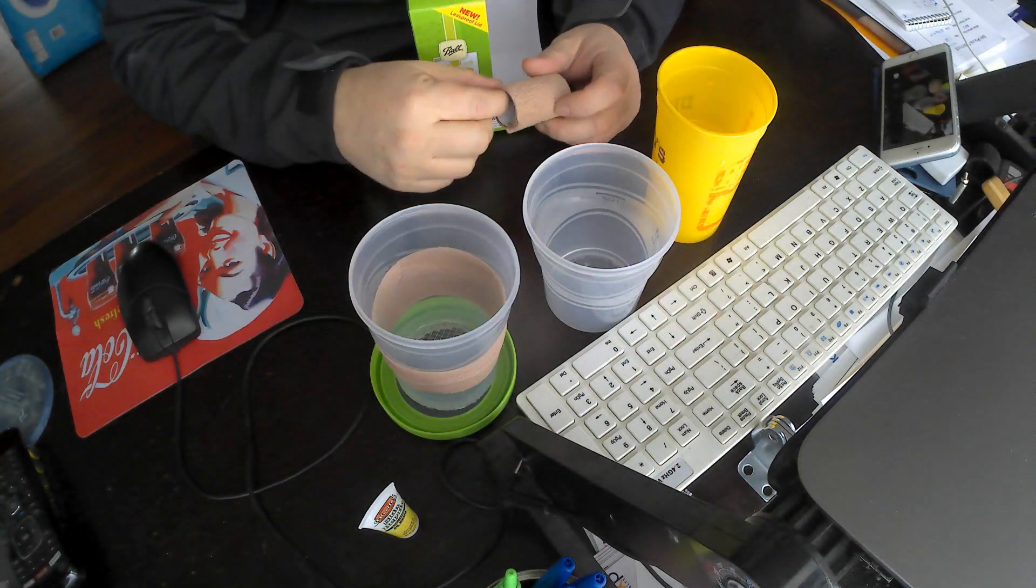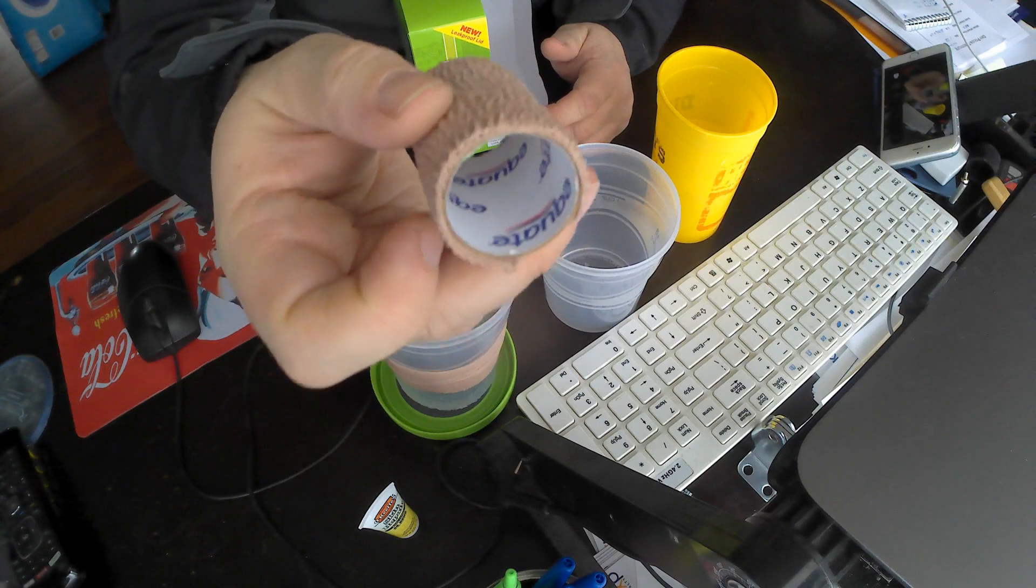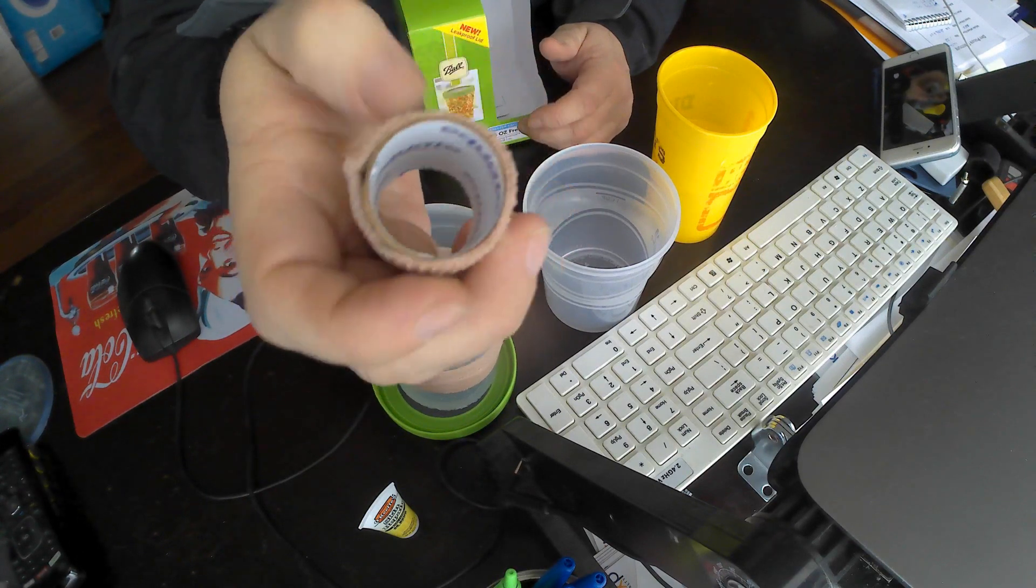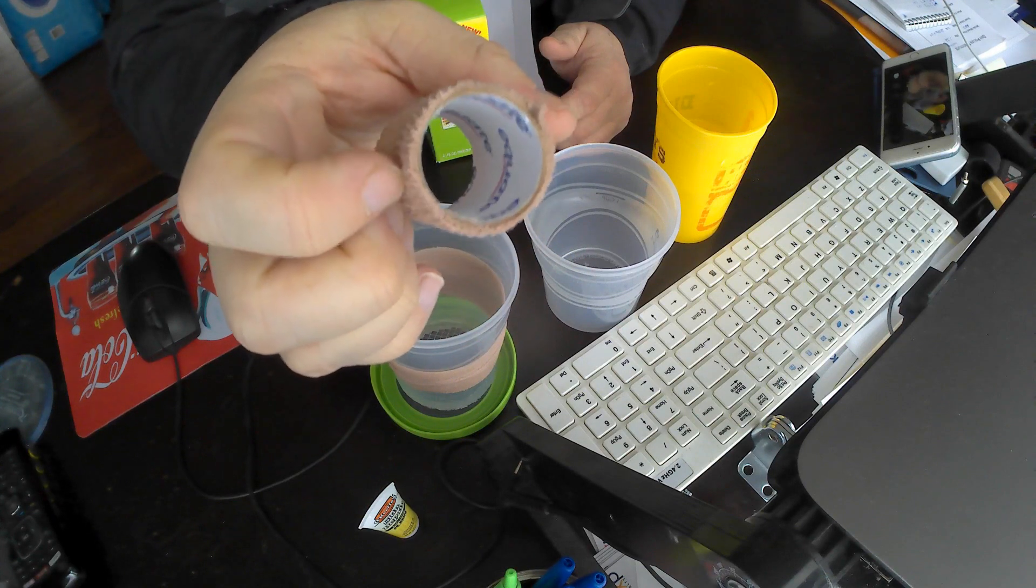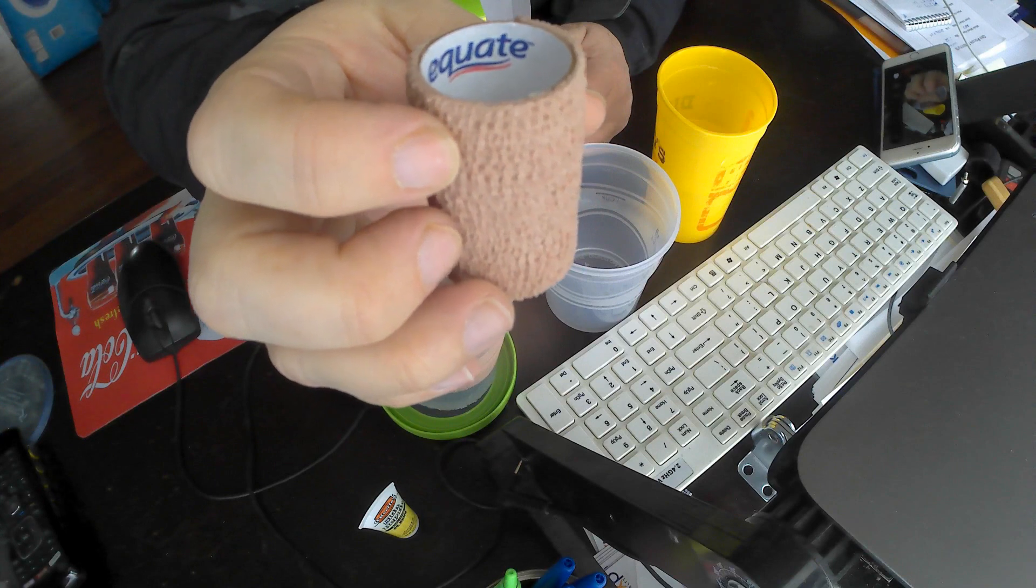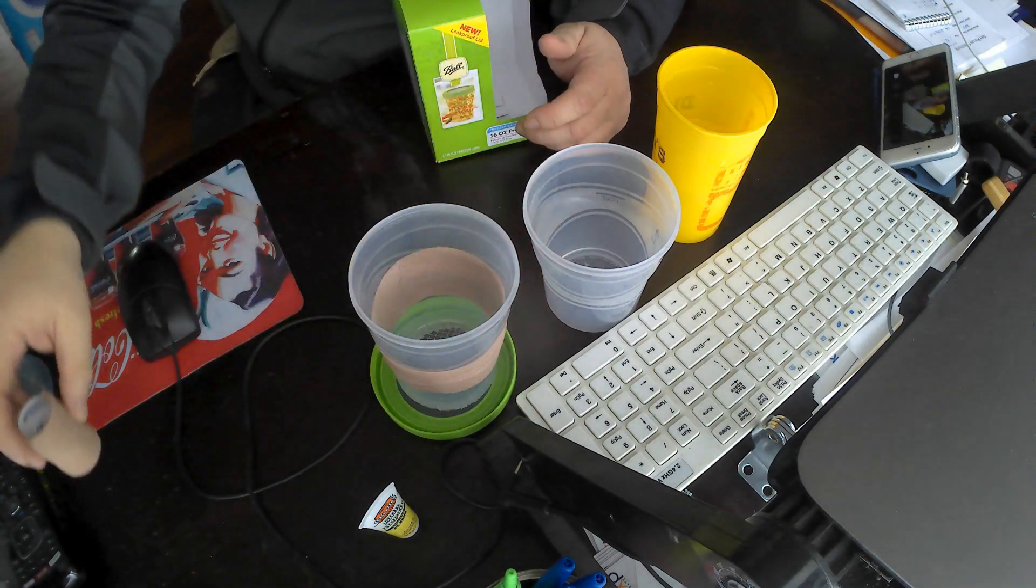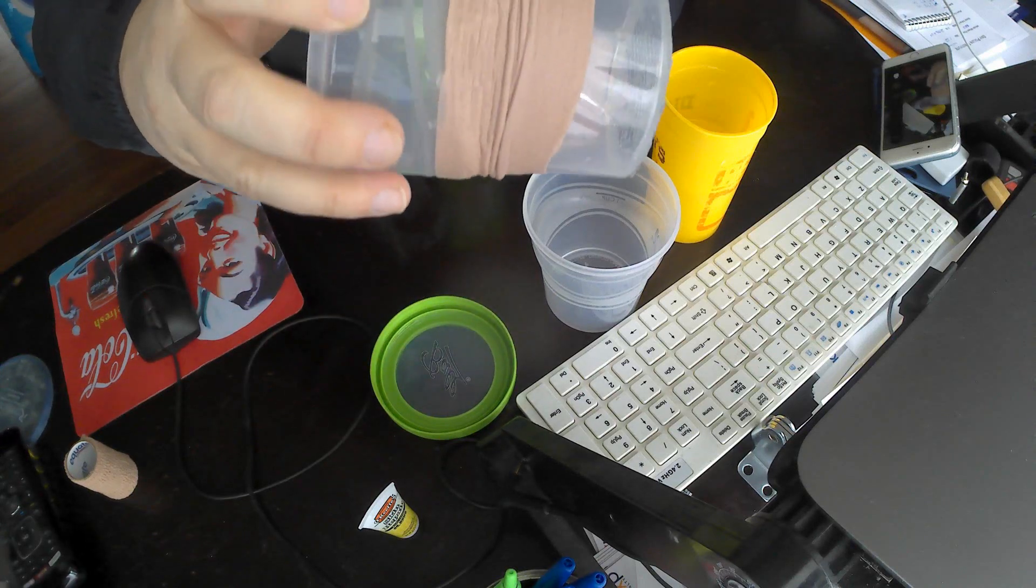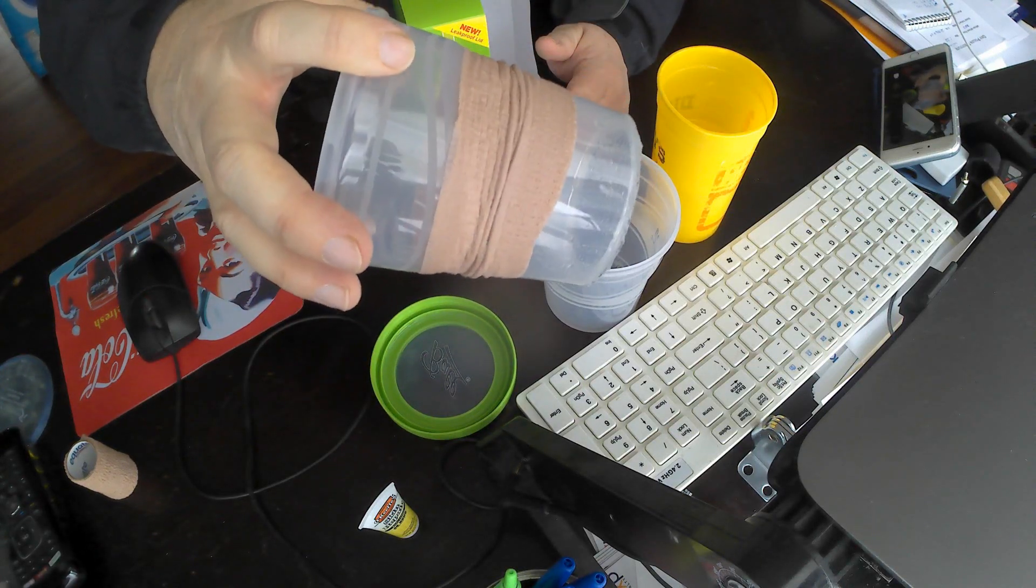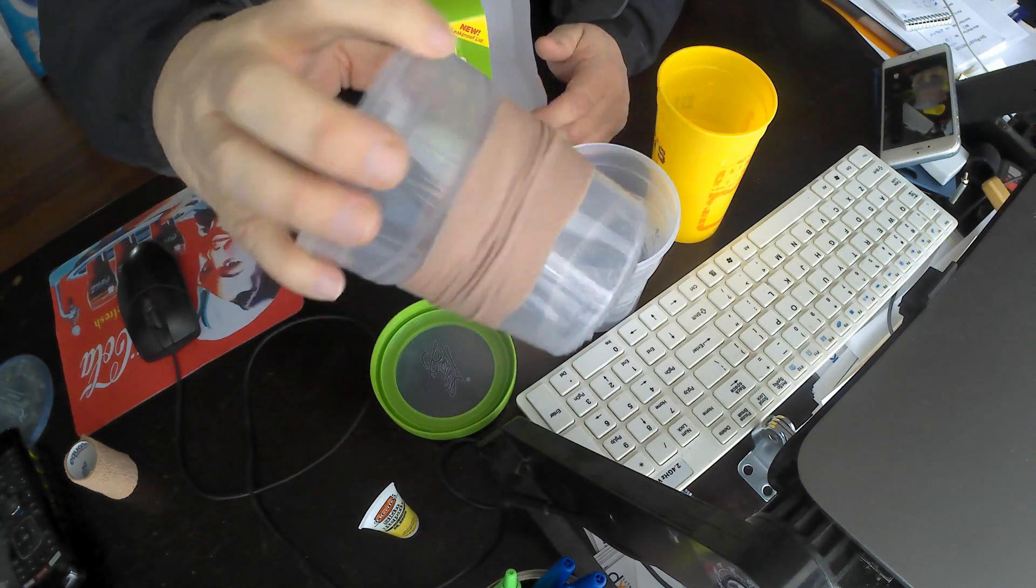And then I just use some of this Equate brand version of self-adhesive sports tape. That creates a really nice seal, watertight, in this case alcohol tight seal. And you can see here, I've actually been using it so it's wet. I mean it is so solid, it doesn't come off and it creates a really good airtight seal.